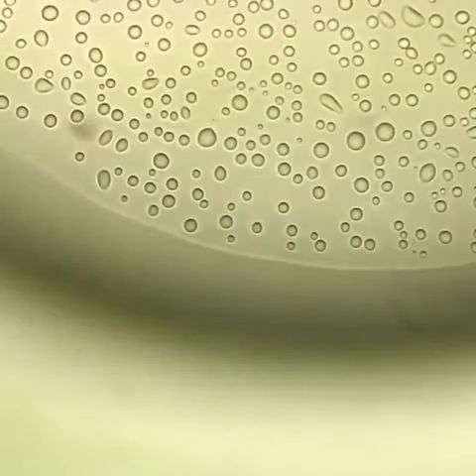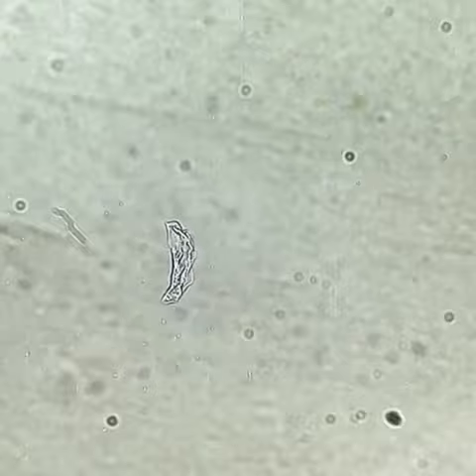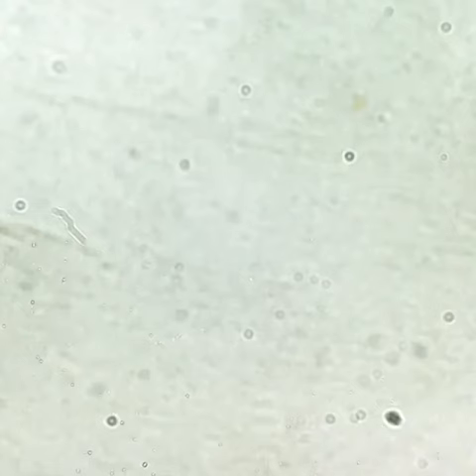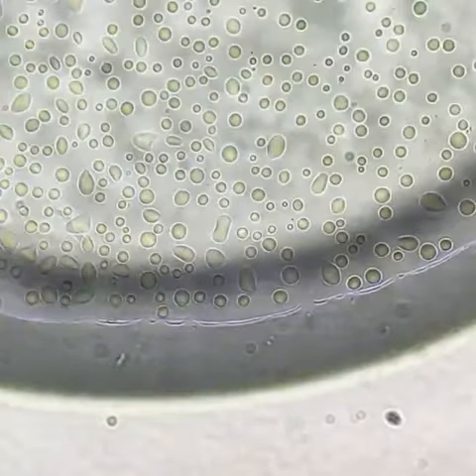It appears that there is not much going on in this sample of water — well, in terms of life anyway. I even used my bacterial lens to have a look. A bit of debris, but it may or may not even be bacteria.